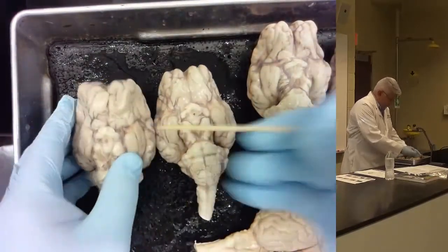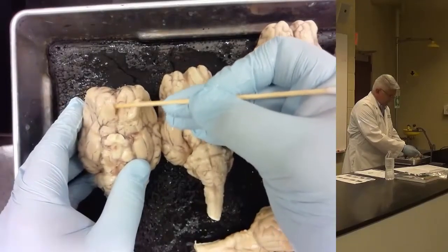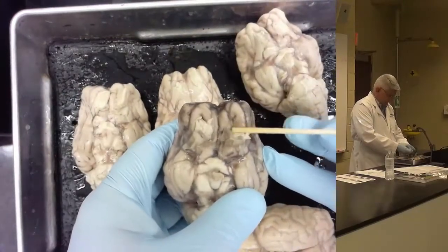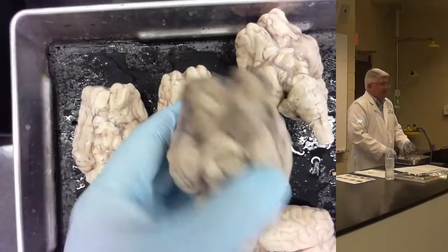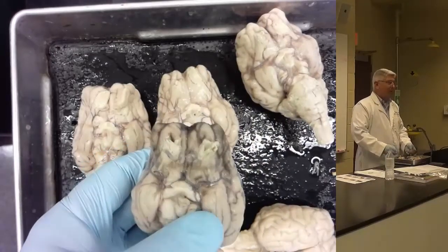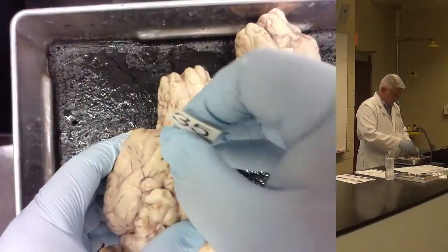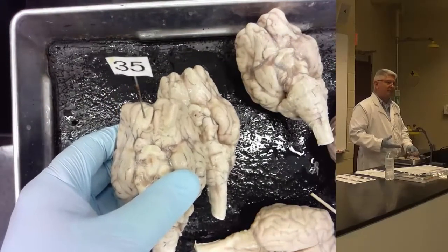Some of the sheep have more defined olfactory bulbs, this sort of flappy, smooth structure at the anterior part of the brain, than others. This sheep's got kind of torn up in the process of taking the brain out of the skull. All right? So, this might be the brain that you're looking at and studying. Probably not going to be the one I mark olfactory bulb on because it's not a very good example. Right? So I would be more likely to use something like this, where I could stick it right in there and you would see that it's in the olfactory bulb. Okay?